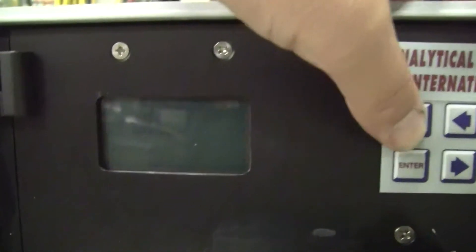It's a little dark, but you can see the menu. Don't have any hydrogen sulfide to test it out, though.